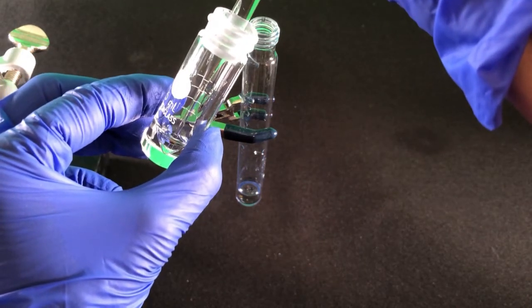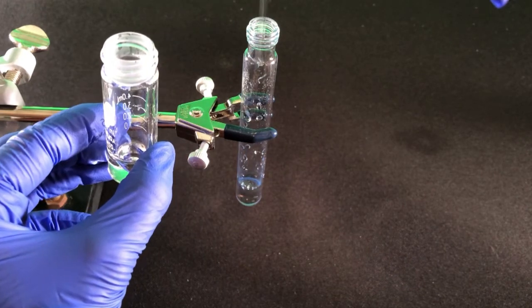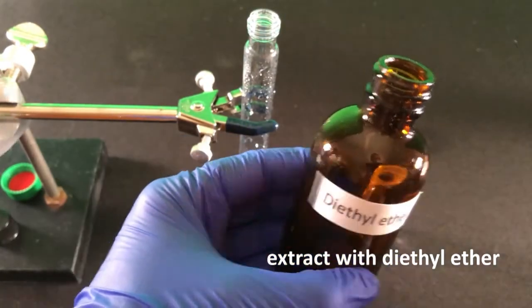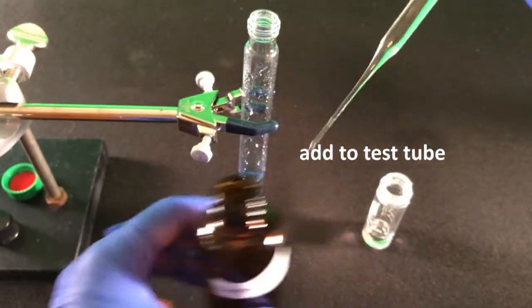You want to extract with something the product is soluble in, or is more soluble in than water. We'll use diethyl ether, which is insoluble in water. Rinse the reaction vial with approximately 1 ml diethyl ether and transfer the solvent to the test tube.